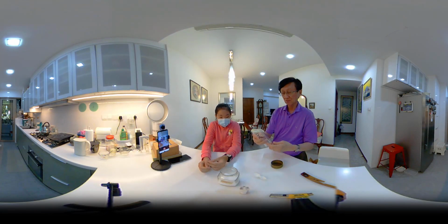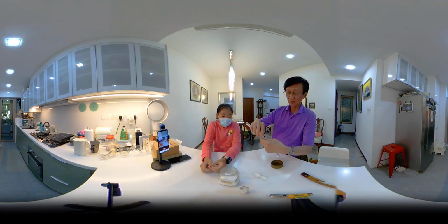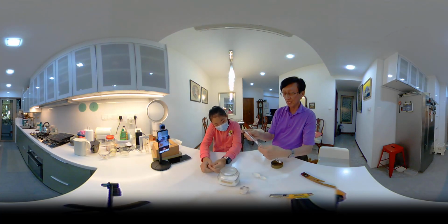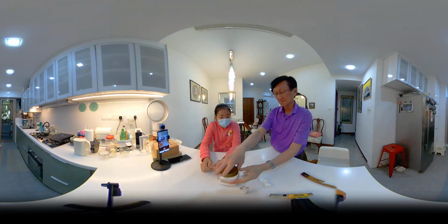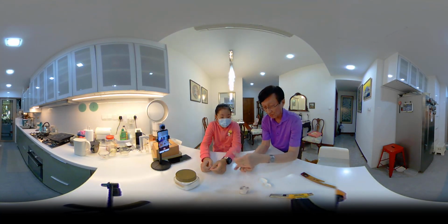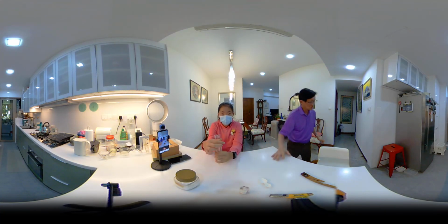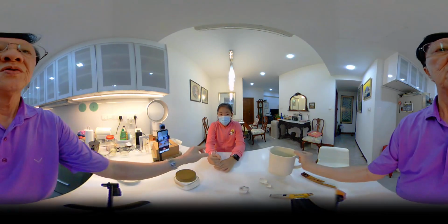Say I now try to use a liquid where only one of the things is soluble. You think I can find a liquid where one of them is soluble? The thing is, it's going to be very difficult. You know why? Because ammonium chloride and sodium chloride are both soluble in water.